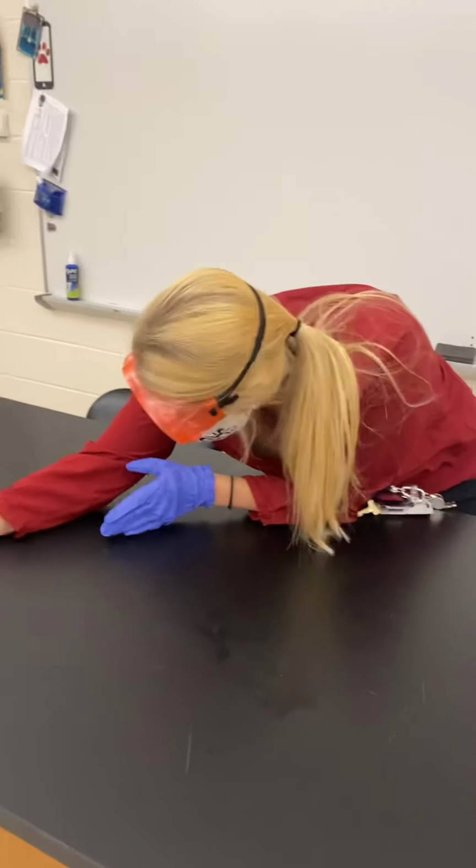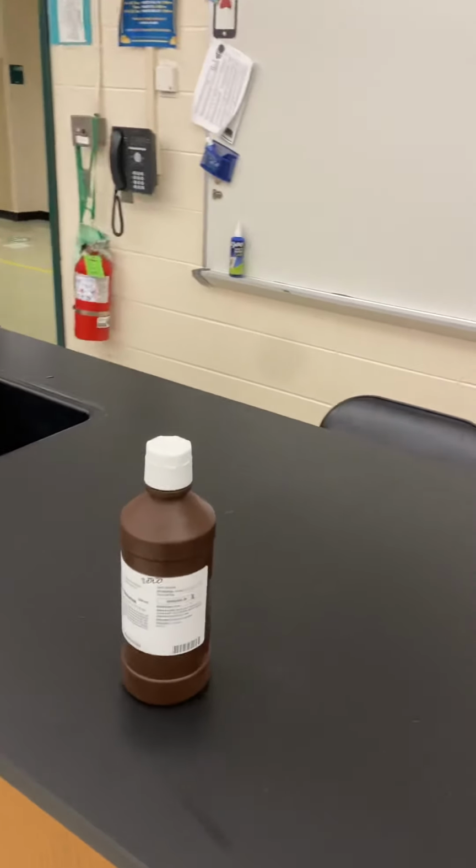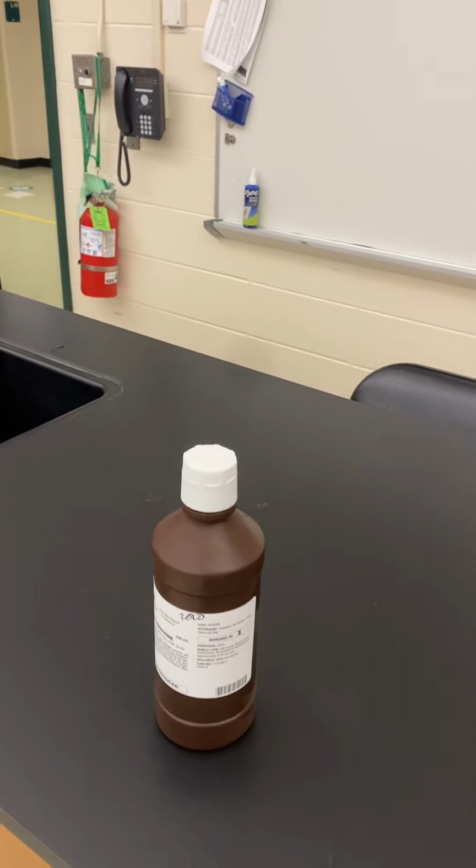So one of you, I'm just going to give you the things that need to go over. Nick, we're going to actually do this reaction in a graduated cylinder. Can you put that, Nick, on the center of the table?